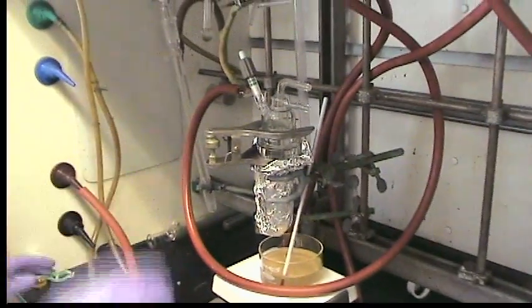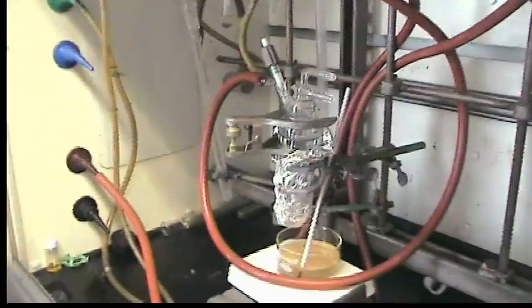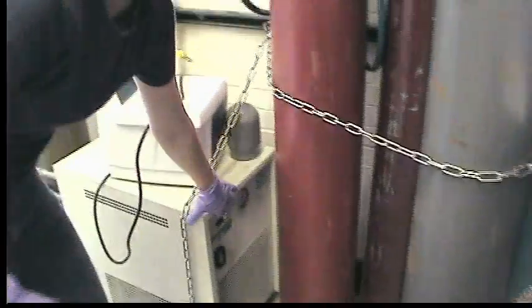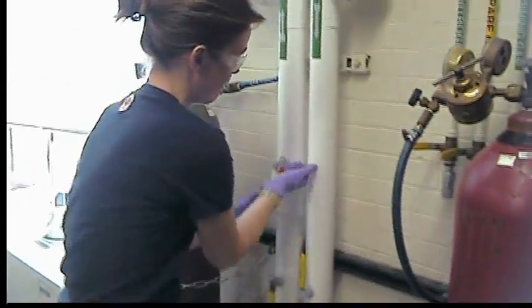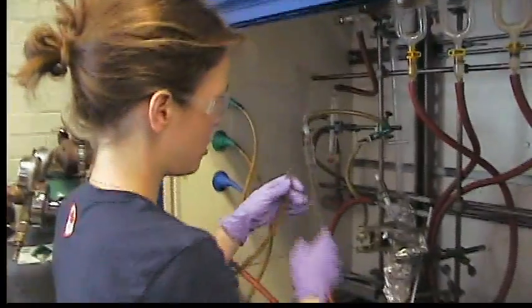So we're just going to let that line pump down for a minute. We have our cooler set to 10 degrees, so we're going to open our recirculator now, and we're going to hook up the water to our sublimator.